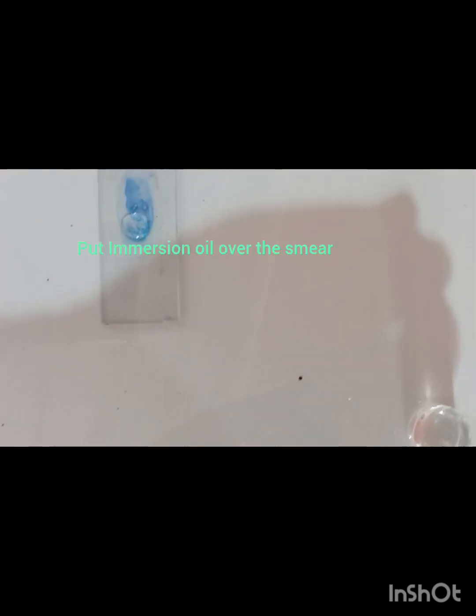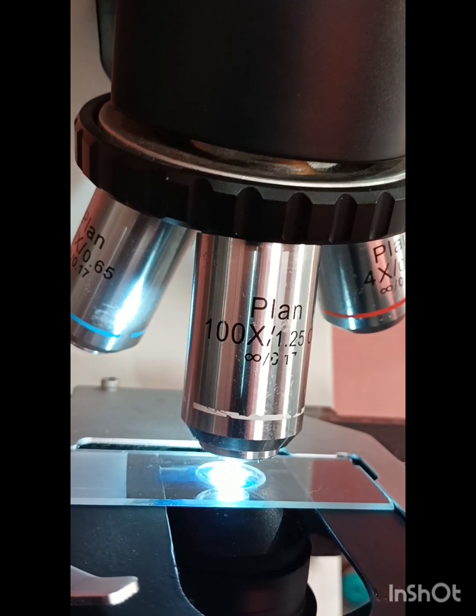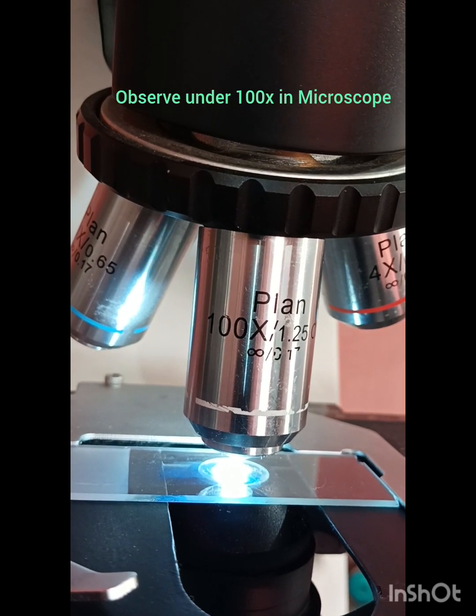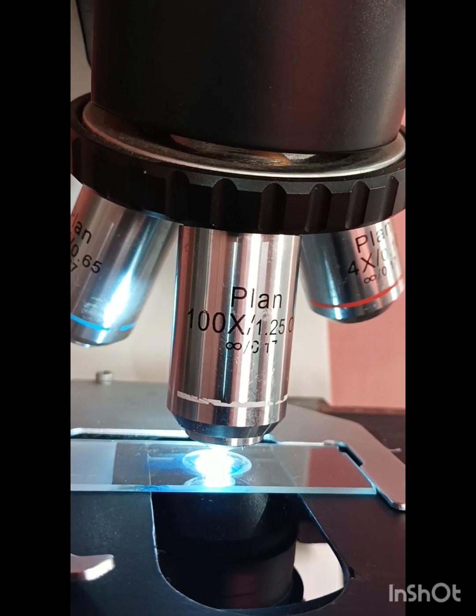Now we are observing it under the microscope. For observation of the smear in microscopy, we have to put immersion oil. Without immersion oil, it can never be seen in the 100x or oil immersion objective. The slide is placed under the microscope and we observe under the 100x oil immersion objective. Now go for the microscopic observation.